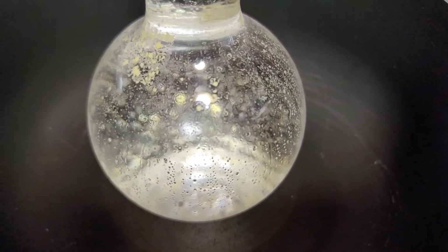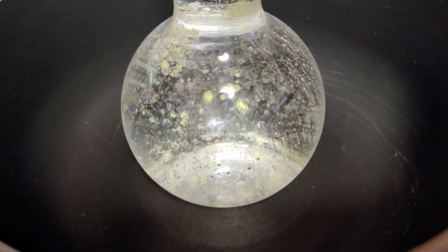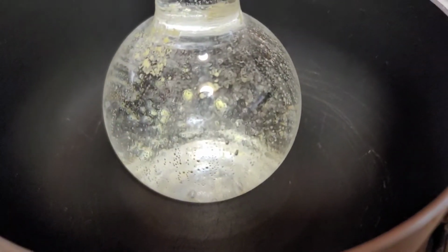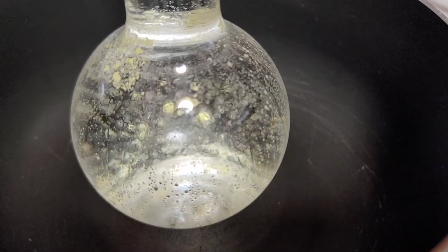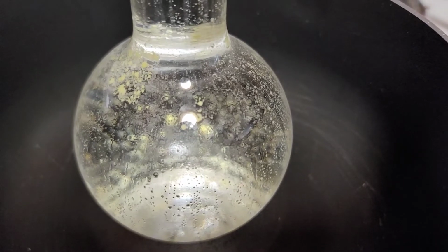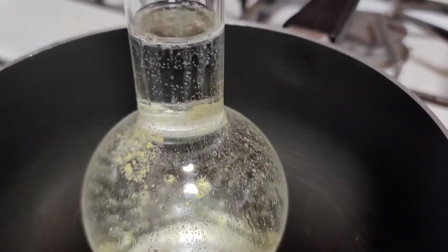I don't have the heat too intense. It's in a pot over a gas burner that is set just a little bit above medium. And you can see gradually material separates from the sides of the glass that was previously very well stuck to the glass, and it comes away into the water and floats up to the surface there.